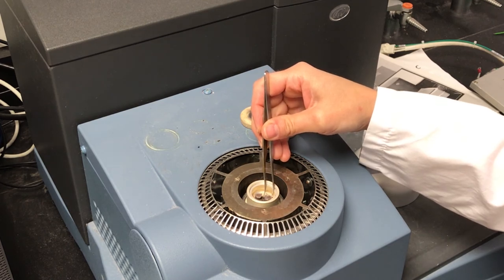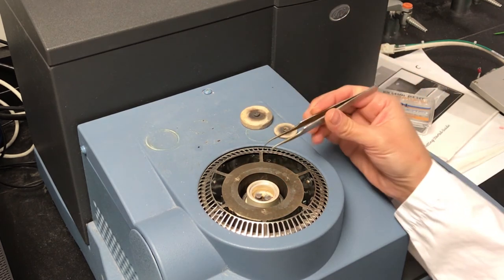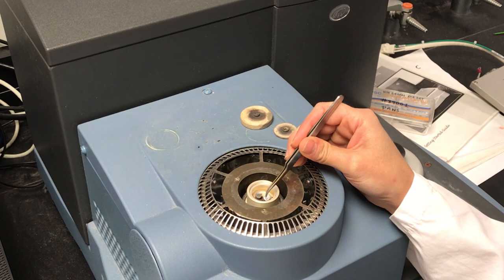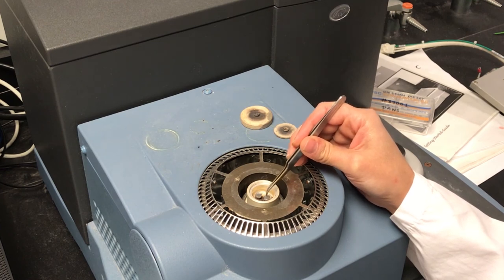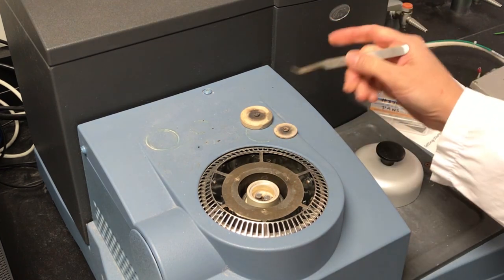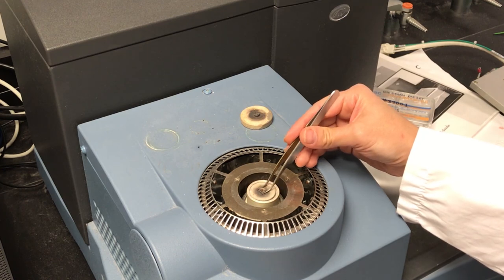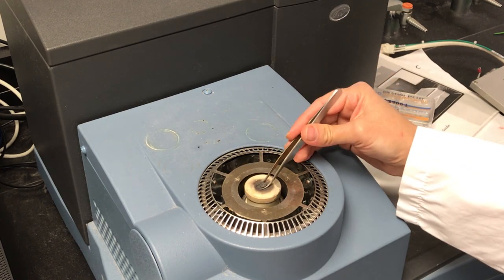Okay, I'm going to take my pan and place it on the sample platform. Just like that. And we can close up the furnace.